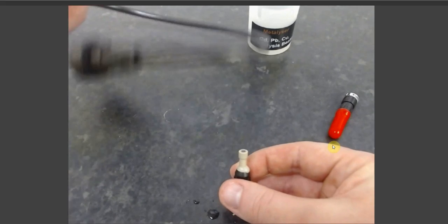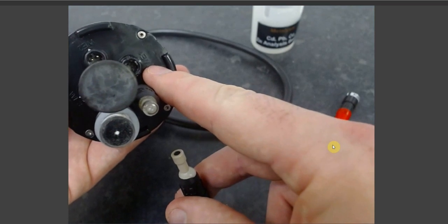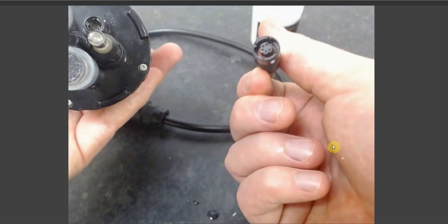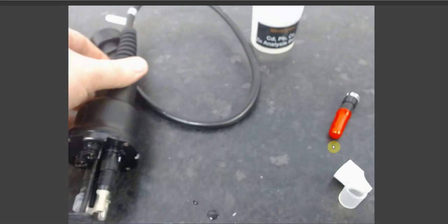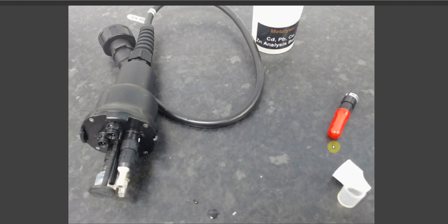You can find the WE1 slot. You can recognize the difference between a WE1 and WE2 again by the number of pins on your electrode. Align the 2 white arrows and push home. Your sonde is now ready for use, bar the polishing of your working electrode, which will be covered later.